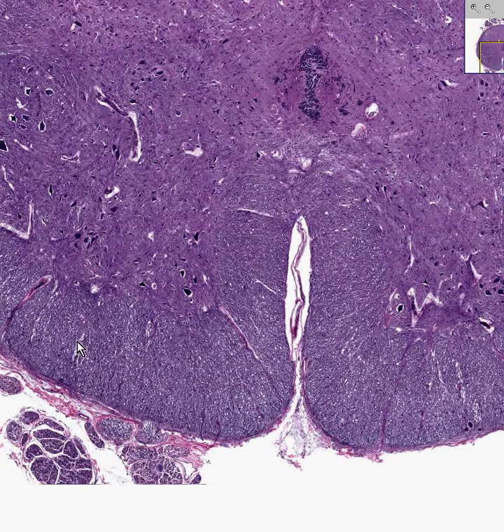And then all of the cells surrounding this, the various tracts of the spinal cord, ascending or descending, are nothing more than myelinated axons or dendrites. Myelinated axons, only in this case, the myelination cell is an oligodendrocyte because it's in the central nervous system rather than a Schwann cell like we see myelinating nerves in the peripheral nervous system.